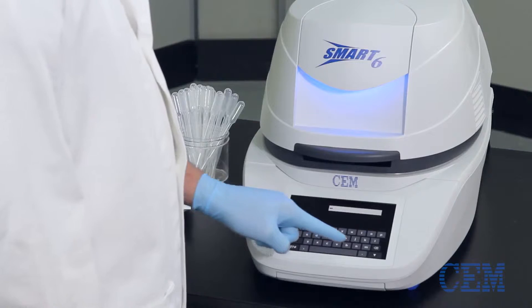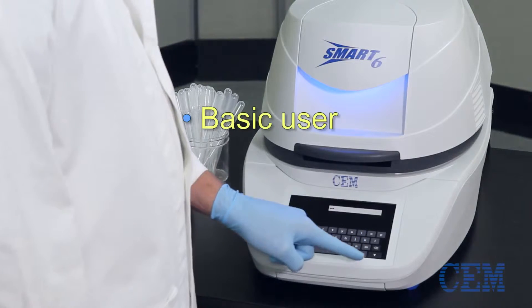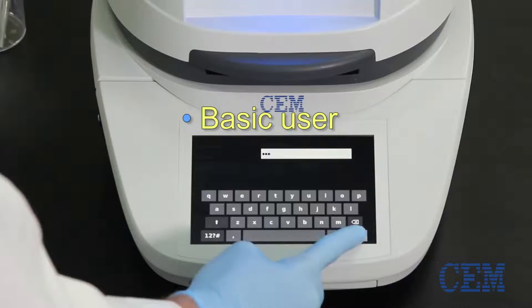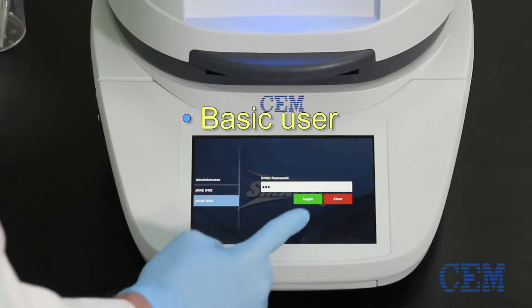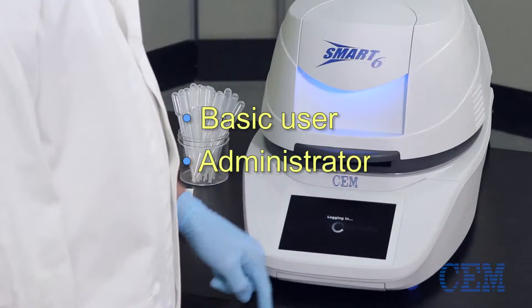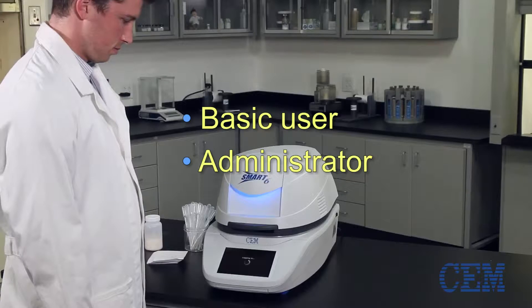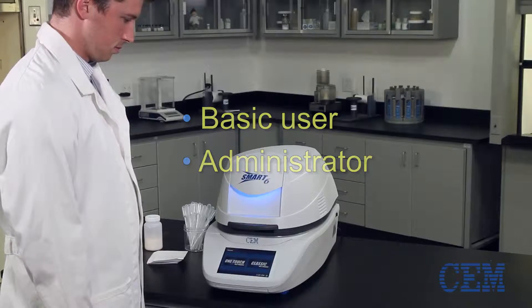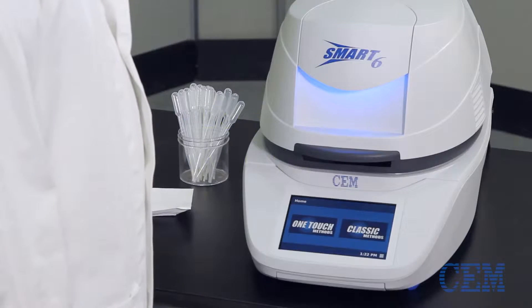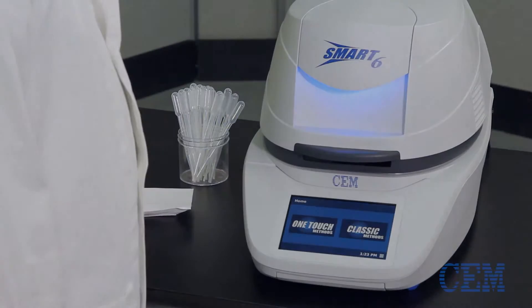A user can either be designated as a basic user, able to change methods and analyze samples, or as an administrator with advanced capability to make system or method adjustments that improve the functionality of your Smart 6 Analyzer.